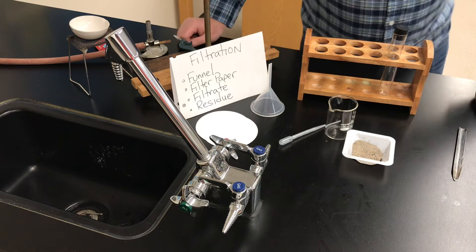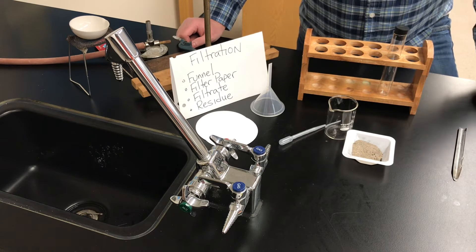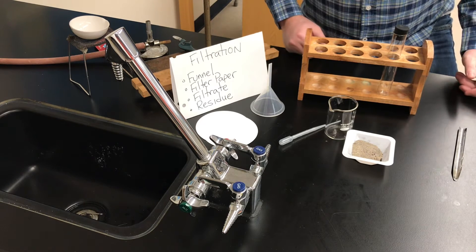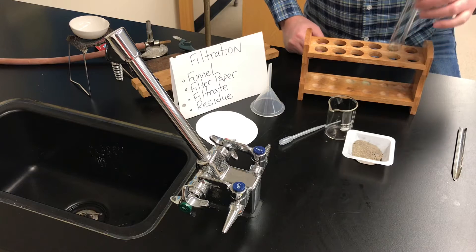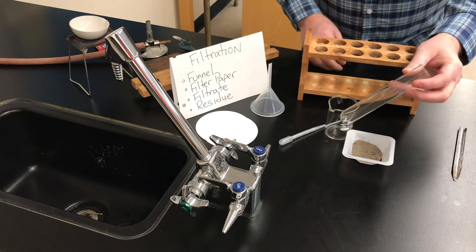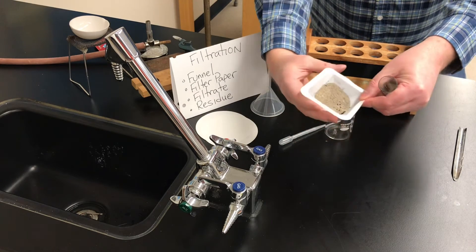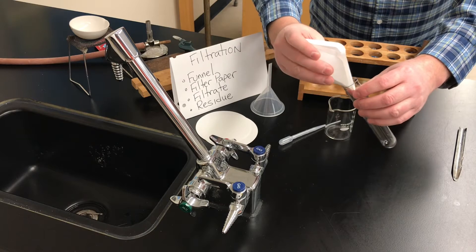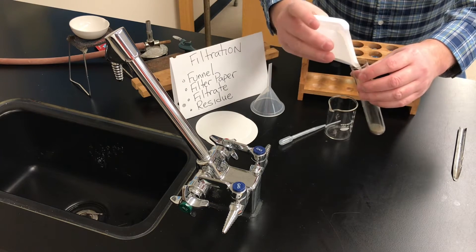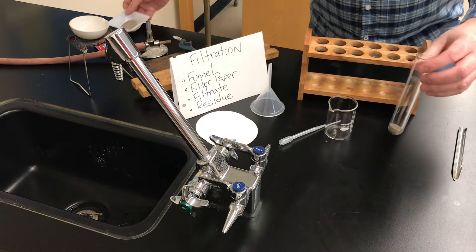There's no one perfect way to do this — there are some things that are better than others, and you might have planned a slightly different strategy than myself. I've decided one of the first things I'm going to do is take a test tube and pour all or some of my sample into it — some sand, some salt, some charcoal — into the bottom of the test tube.